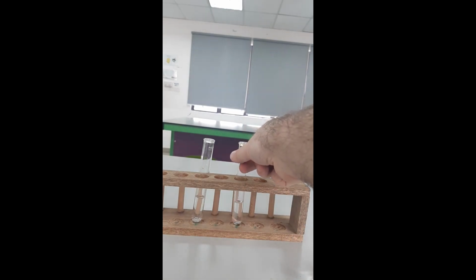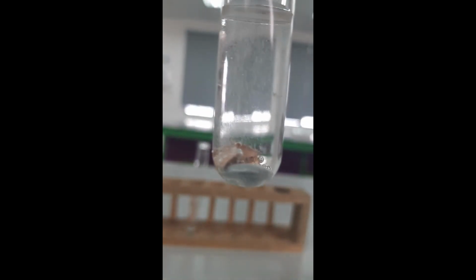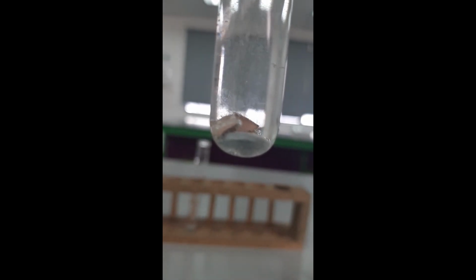And I'm going to add sulfuric acid again to that zinc with the copper in it this time. And we should again see bubbles produced. But, again, if I can get it to focus, we should see the bubbles are being produced much more quickly. Now, copper is very unreactive. It doesn't actually react with acids. So that hydrogen is not coming from the copper, it's coming from the zinc.